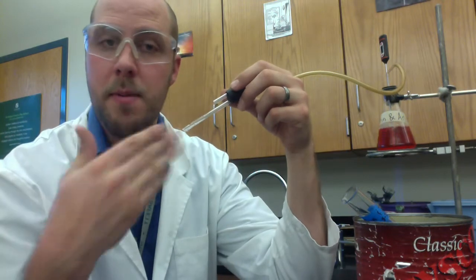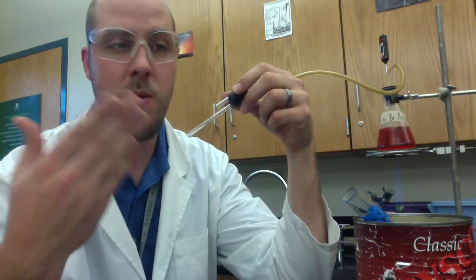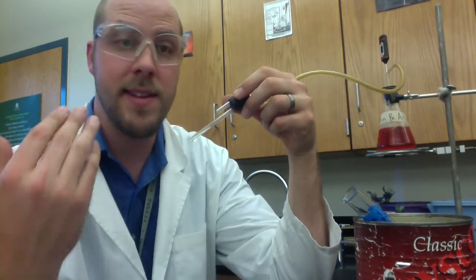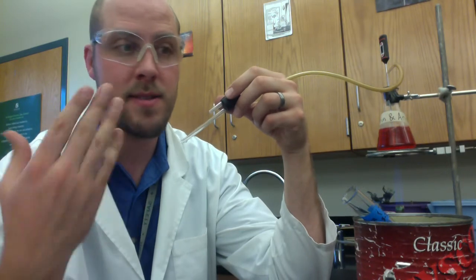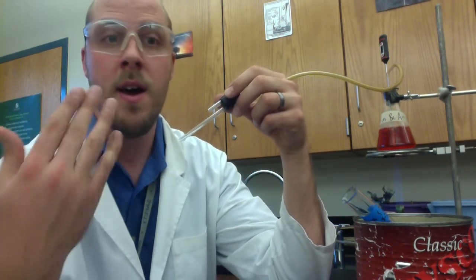One of the things about this lab is you need to be a little bit patient. It's going to take a while and there's going to be some down time. But that's fine. That happens in science. Sometimes it takes us a long time to run our reactions. What I'm going to have you do at that point is be quizzing your partners on chemical symbols.